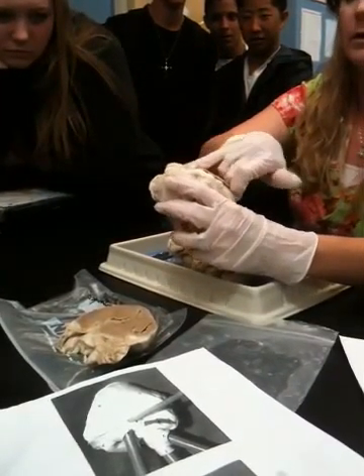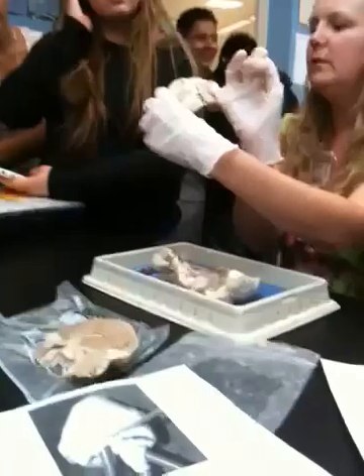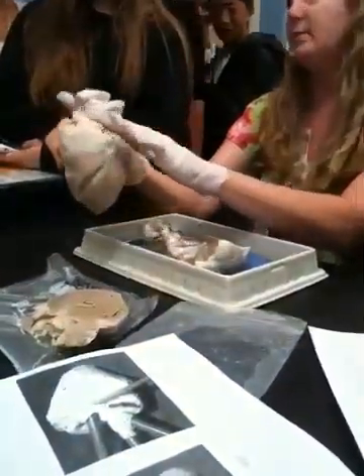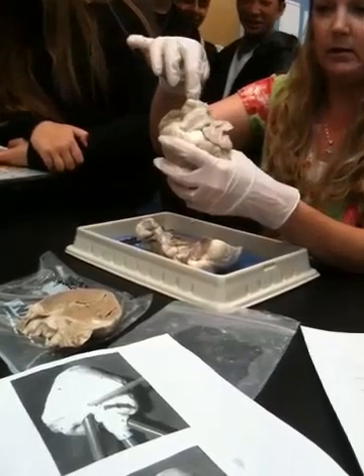The superior vena cava. No. Aorta. Darn it, it's right in the front. Pulmonary, no, the trunk of the pulmonary artery, right? Everybody could see this one, no matter what heart you had. That was not cut off all the way, okay? And most of you guys could see this part right here, which is the aorta.